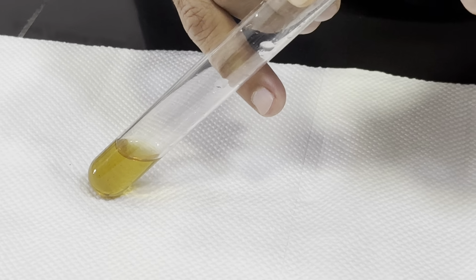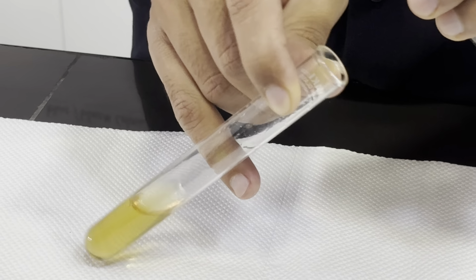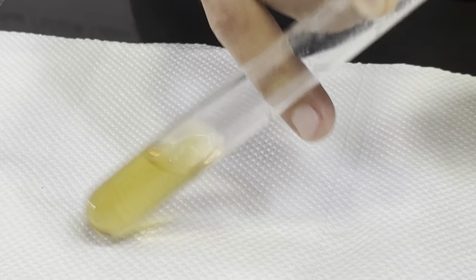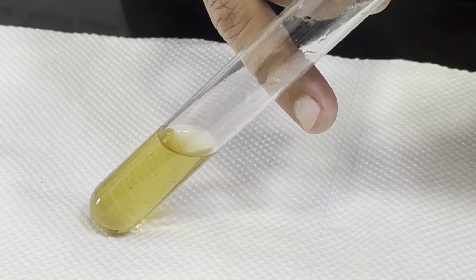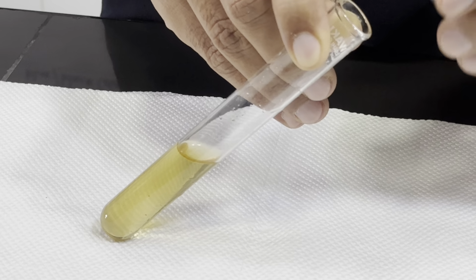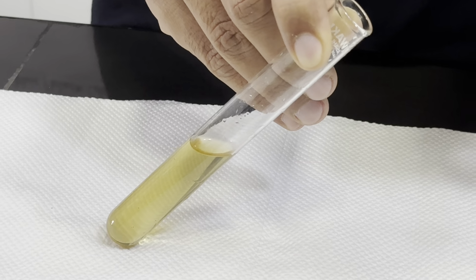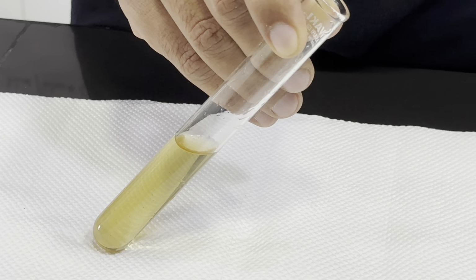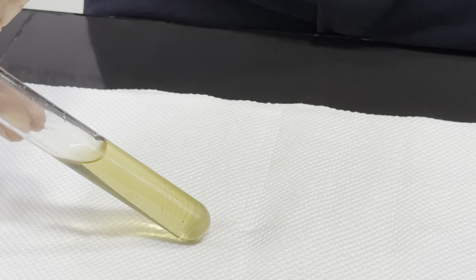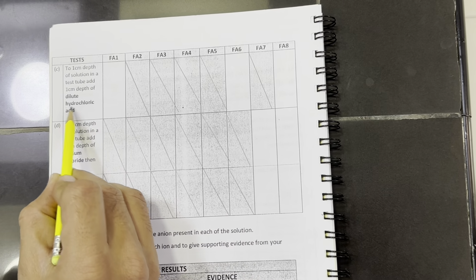If we add more Fa6, this brown solution will go down to a colorless solution. So we will observe it. Now you can see the solution is turning colorless gradually. Since the concentration is low, more amount is needed to decolorize this, or else just the observation is purple to brown. That is again the right observation: purple to brown, and purple to colorless are again the same, right? Now the next test is with hydrochloric acid.